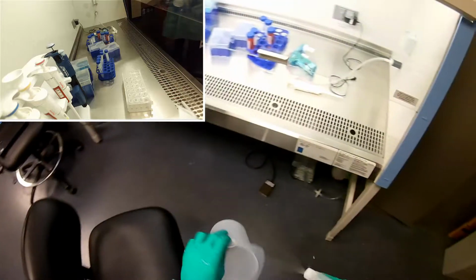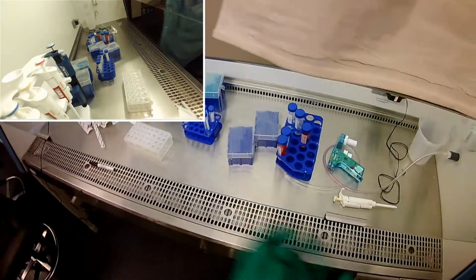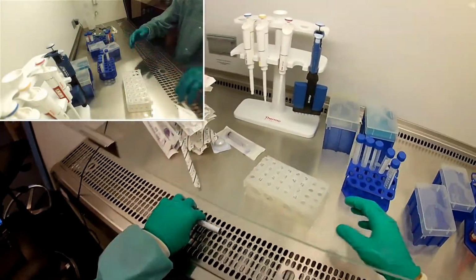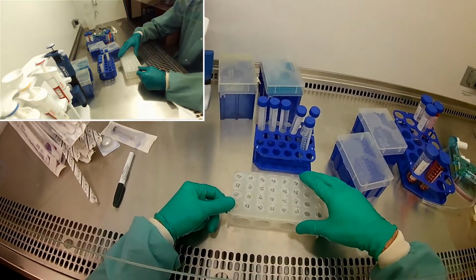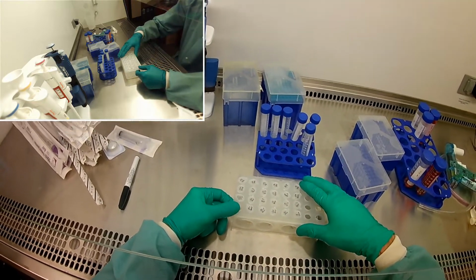The last thing we need to do today is mix the chemicals that we're going to test the cytotoxic effects on our cells. So we're going to do that by serial dilution in low serum media. Okay, and so what I have already planned out, and then I'm going to ask you guys to do some math for too, is my experimental groups.